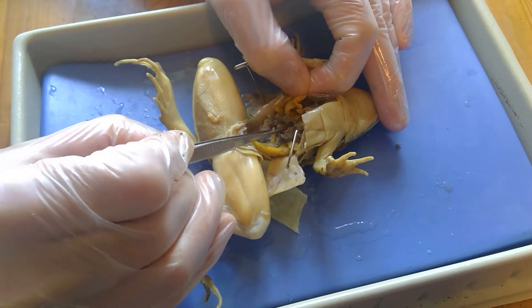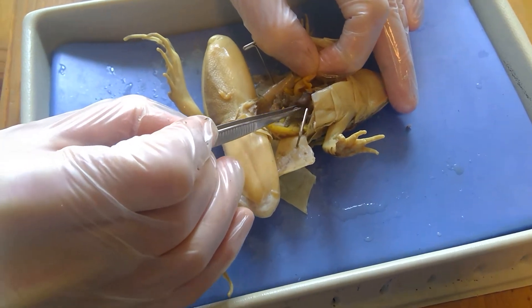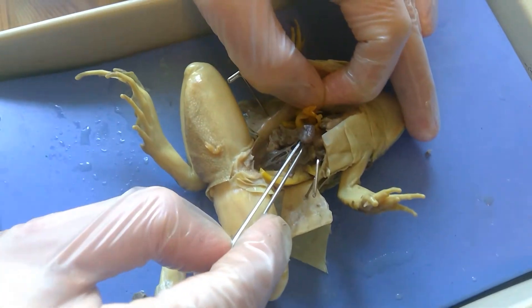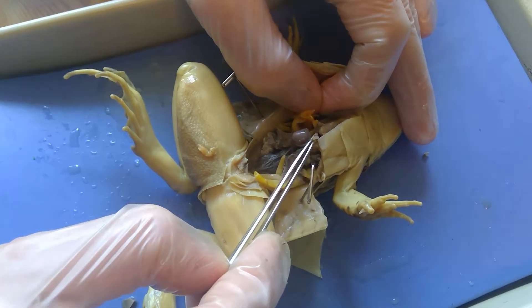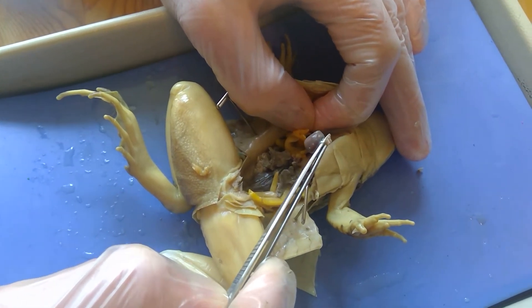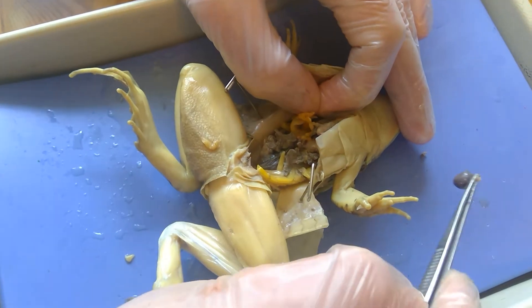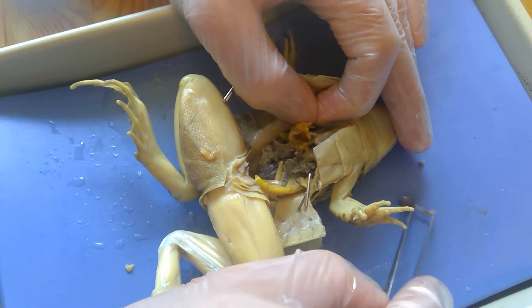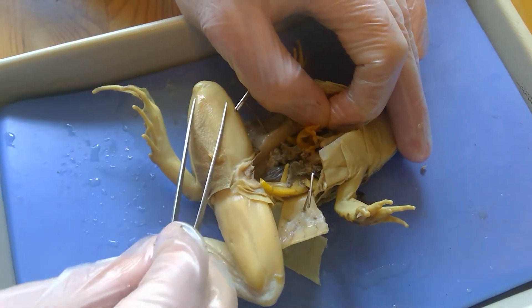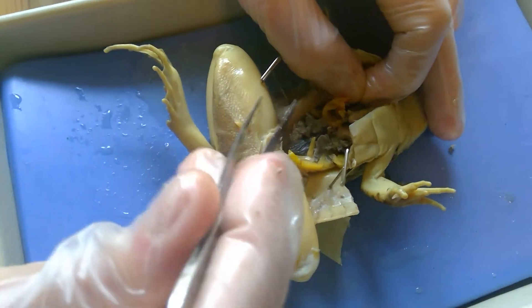The spleen is not part of the reproductive system and it's not part of the digestive system — it's part of the immune system. It's going to filter out red blood cells and also produce white blood cells. So frogs, like us, have an immune system.